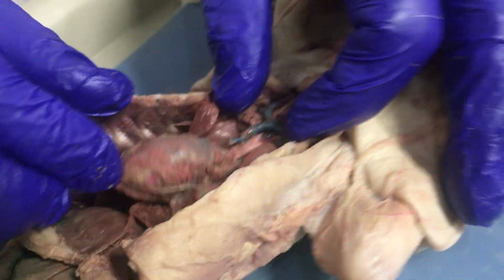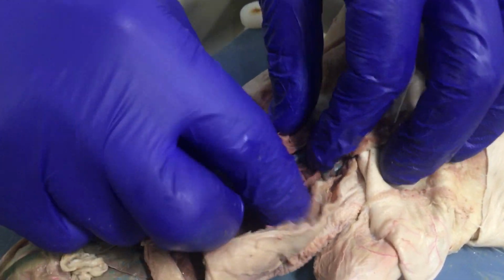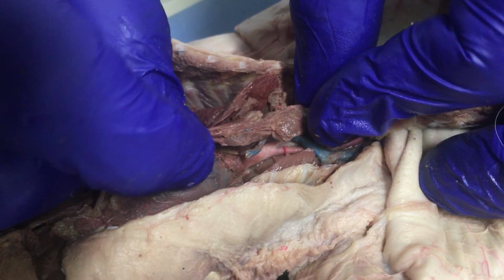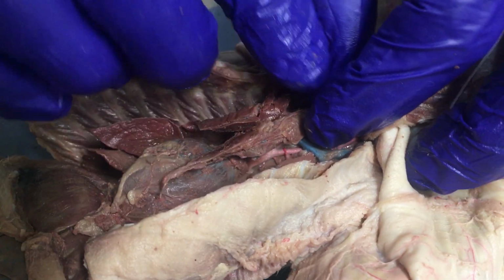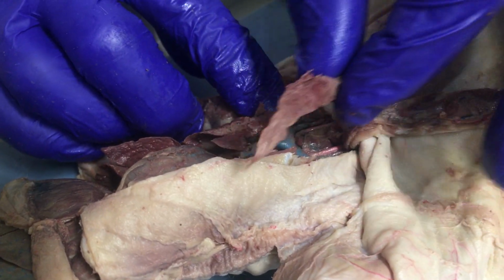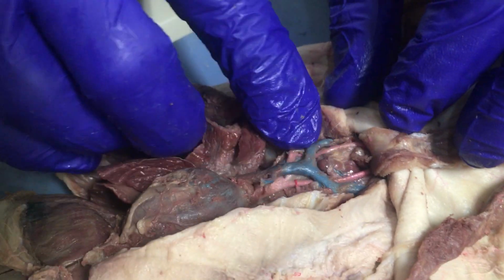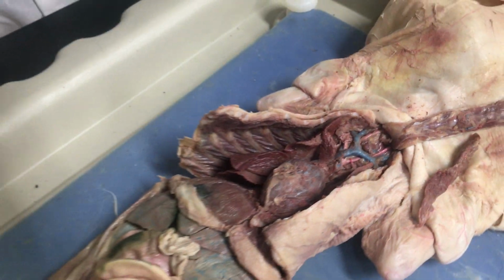Lastly, where did mine go? Oh, there it is. The last thing that we found in terms of organs was the thymus gland, which was sitting like this over part of the heart and up through the center of the thoracic cavity. We took the thymus gland out, and then we could see the blood vessels here in the cat. So why don't you stop there?